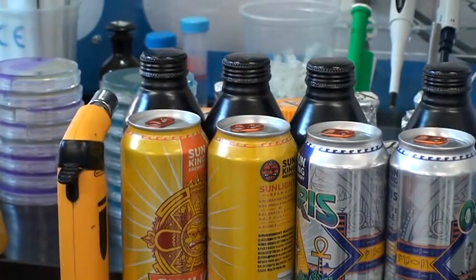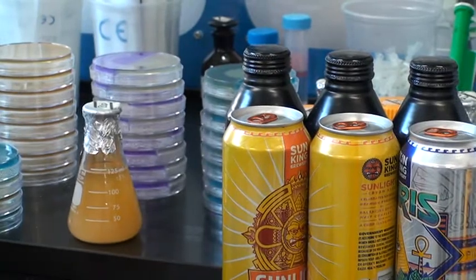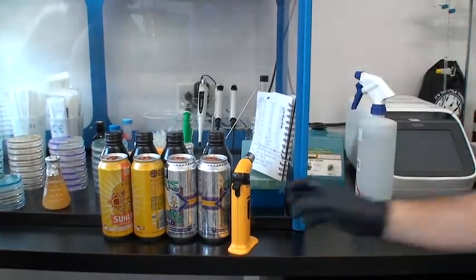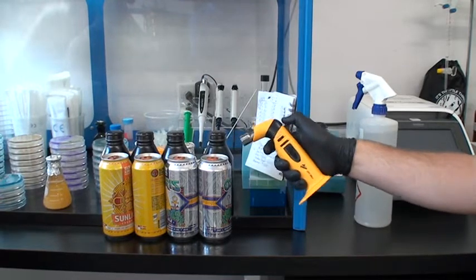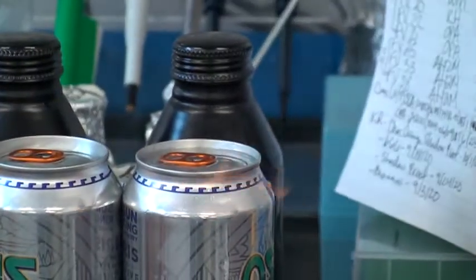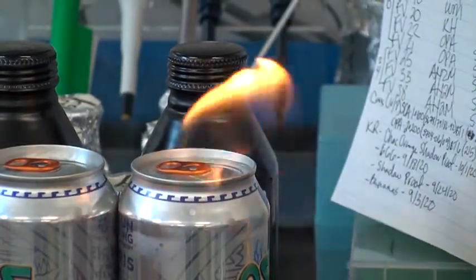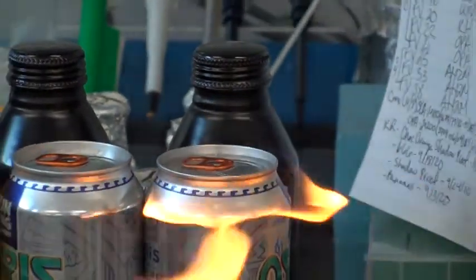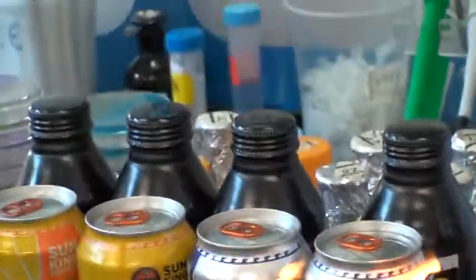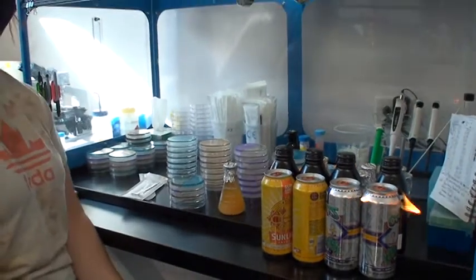Sometimes you actually flame the tops of the cans. You spray the ISO and then light the alcohol to kill it — it's a flame sterilization. So if there's any residue on top of the can, if the lid or tab is dirty from us touching it, we're going to kill all of those microbes on top of the can because we don't care about those. All we care about is what's inside the can itself. A quick flame sterilization kills all that, letting us pull a sample from what's in the can only, to put on a plate. You want to make sure you're not pulling false positives.